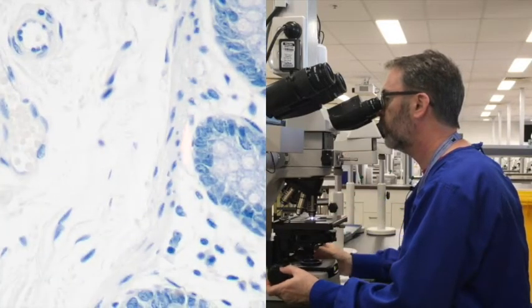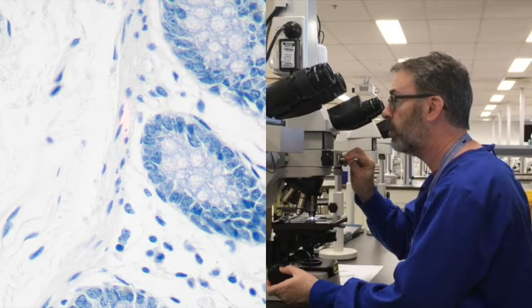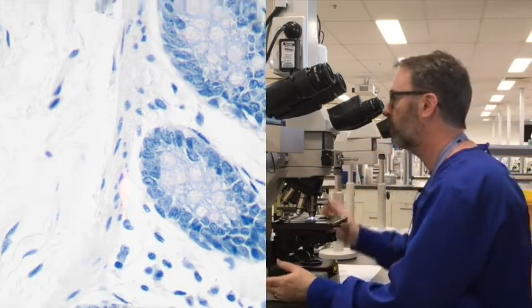If we look to the layer of smooth muscle that was just beneath the mucosa, so the muscularis mucosae here, it's very pale. In fact, you can hardly see any colour to the muscle. And yet, importantly, the nuclei have not been adversely affected. They're still staining quite strongly.